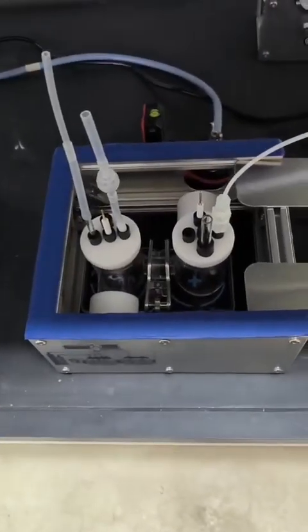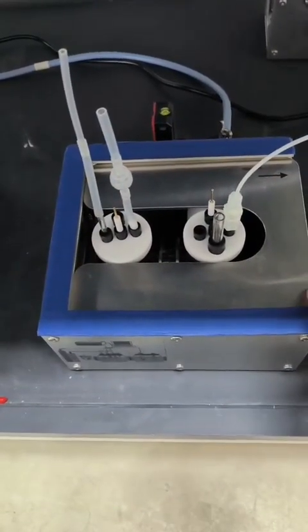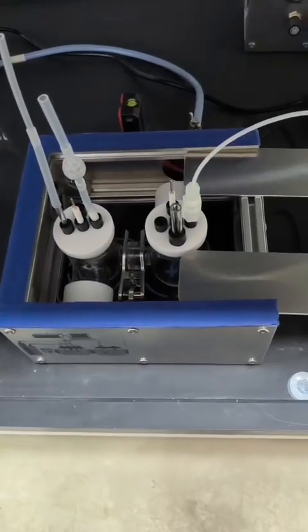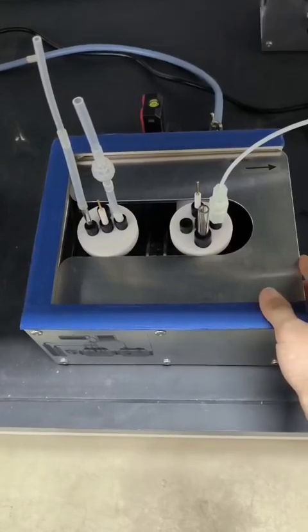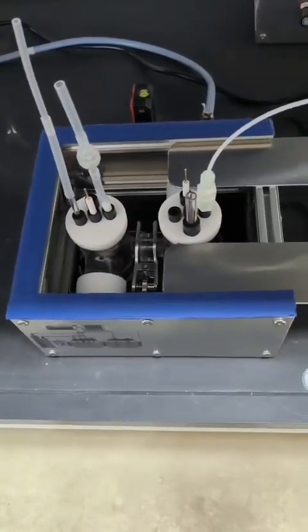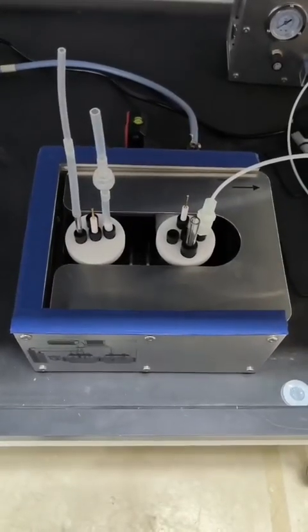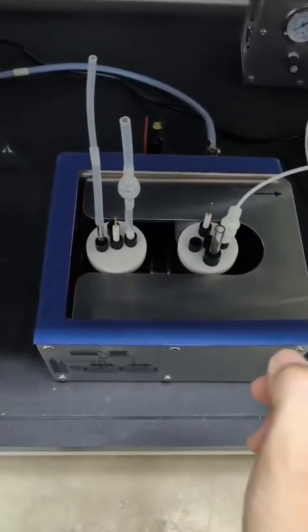After you finish the reaction, you can slide down the cap to prevent leakage of light to the outside, to protect the operator. This one can slide in and slide out. When you plan to take out your reactor, you detach all the connections with other accessories.